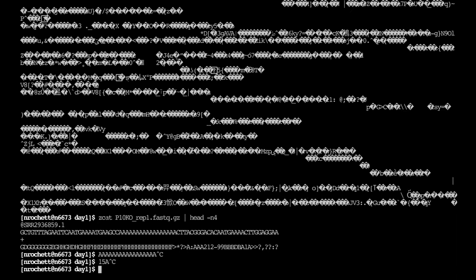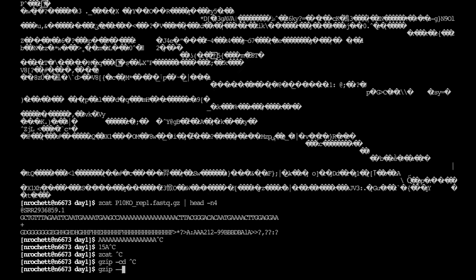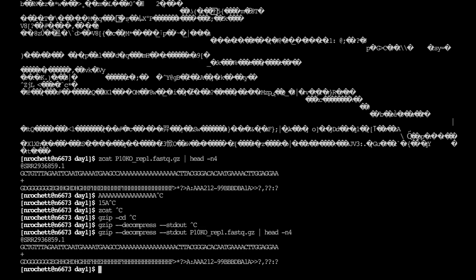So keep your file gzipped, and then you can zcat it. The other command you can use, which is equivalent: zcat is exactly the same as using gzip -cd, which stands for gzip decompress to standard out. And standard out is just the terminal or the pipe. So in particular, if I do this, it is the same as doing zcat, right?